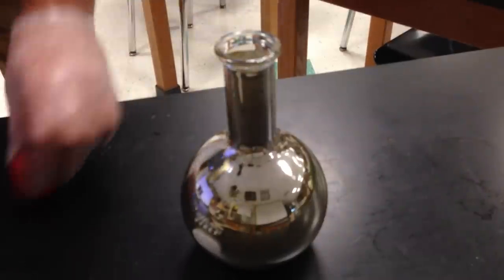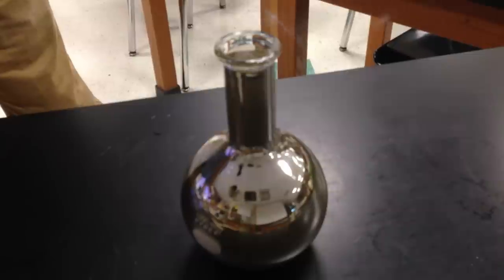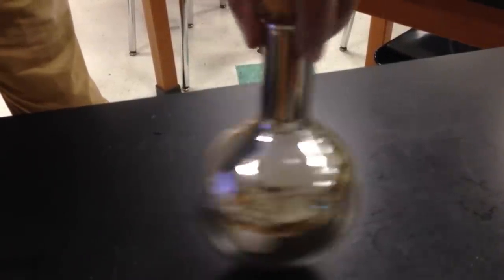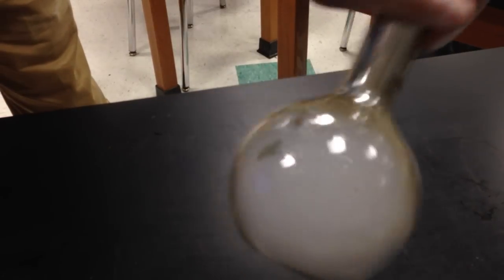And you can see already, put the top on, shake. This beautiful flask that was silver-plated is now going back into ions.